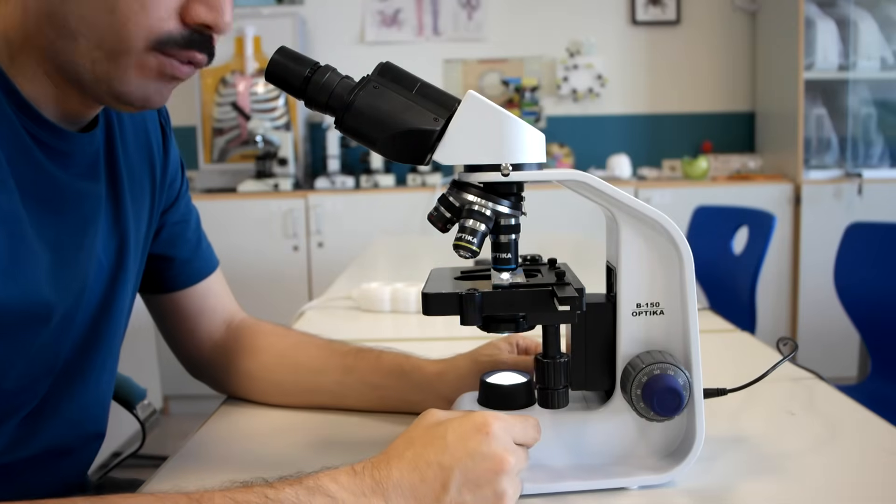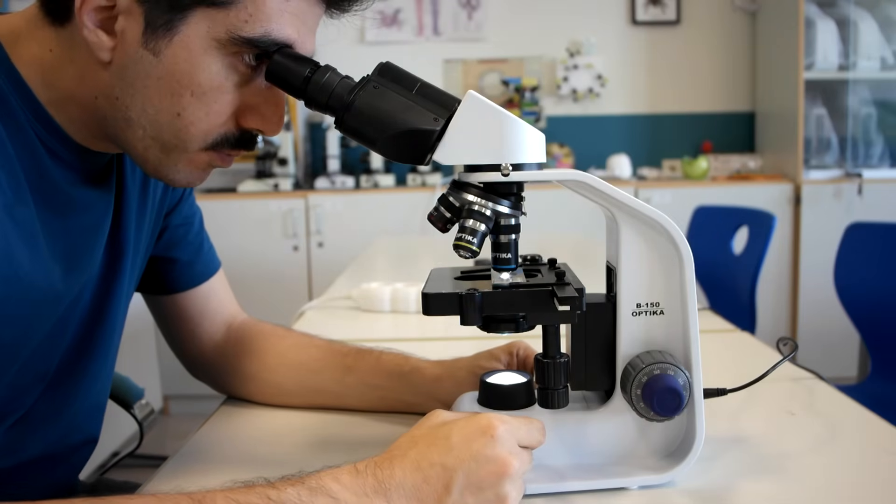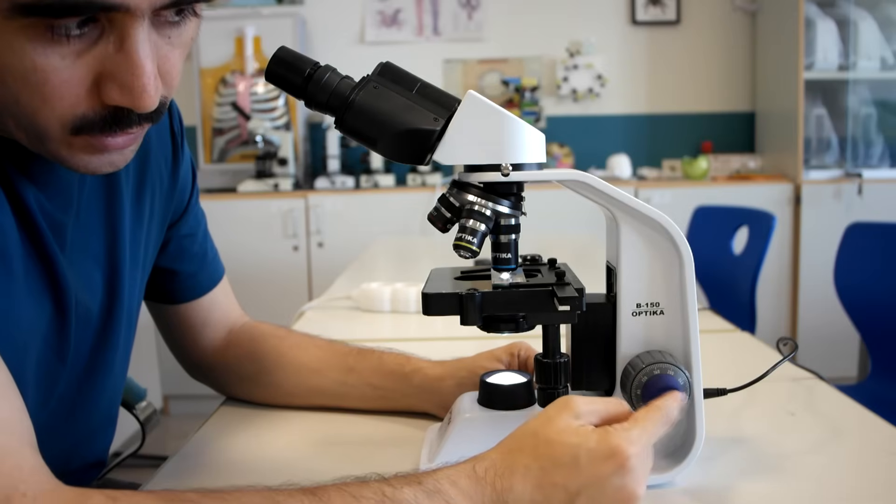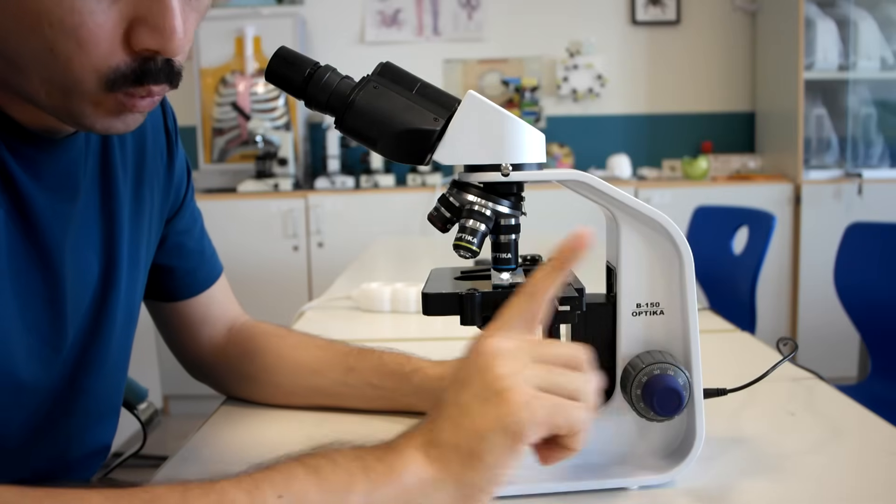Change the magnification, just the fine adjustment knob. The coarse adjustment knob we don't use.